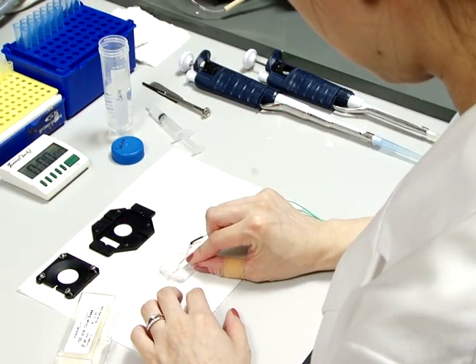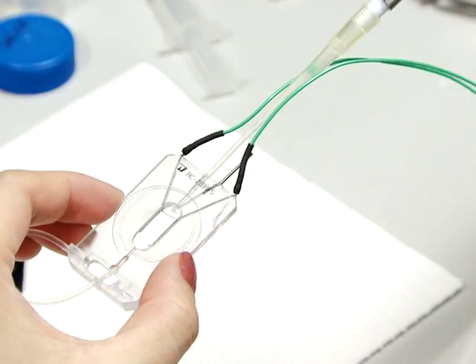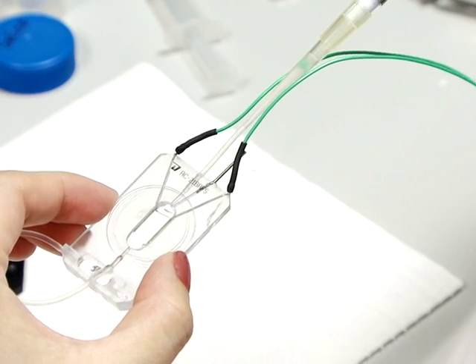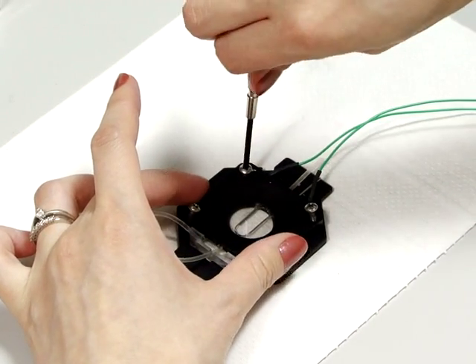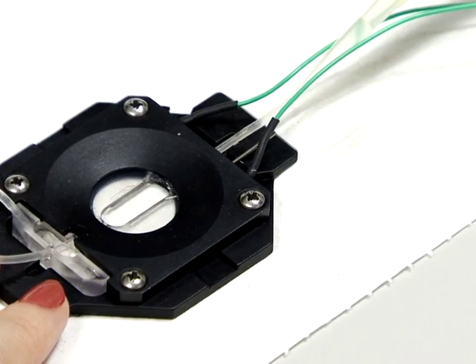Seal the chamber by gluing a clean cover slip with silicone grease to the top. After that, remove any air bubbles trapped in the chamber with the input and output tubing. Then, immobilize the imaging chamber in a stainless steel platform. Check for leaks by gently perfusing saline solution through the input tubing.